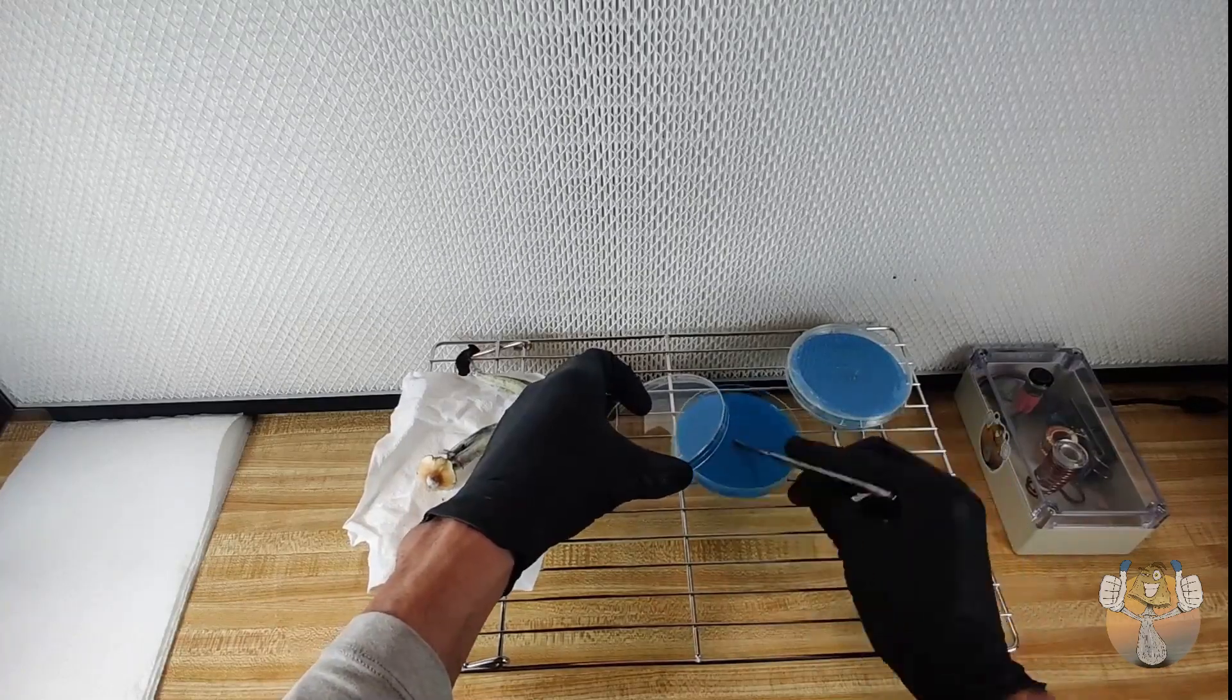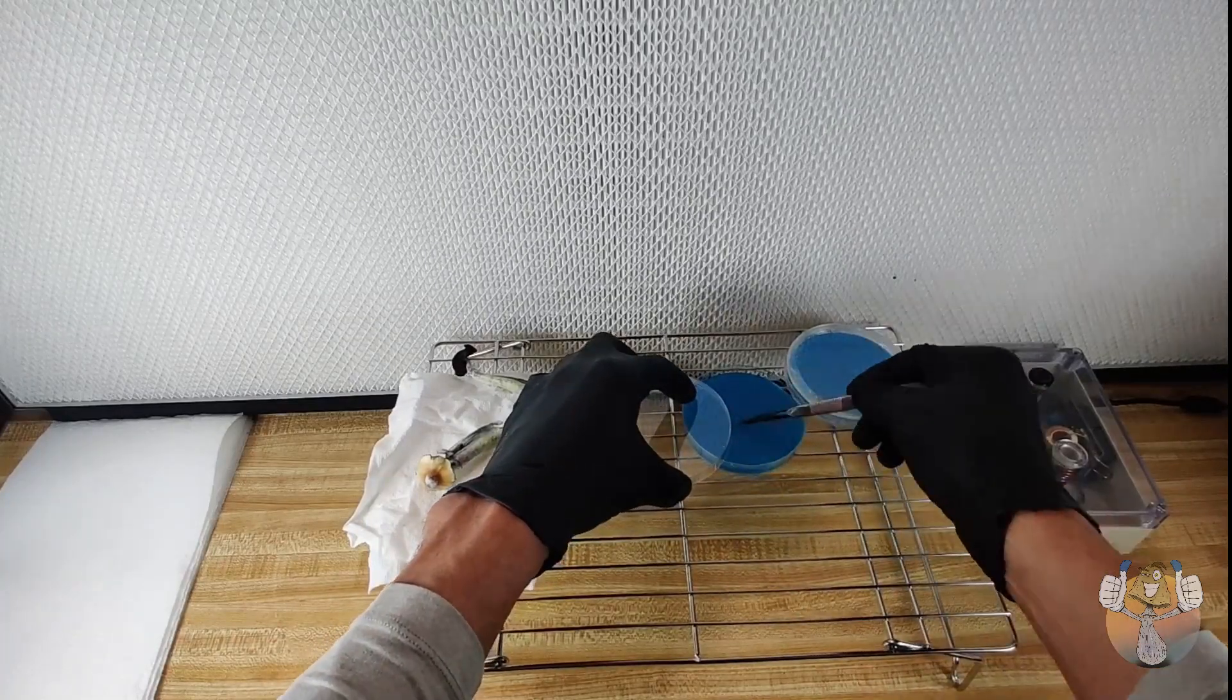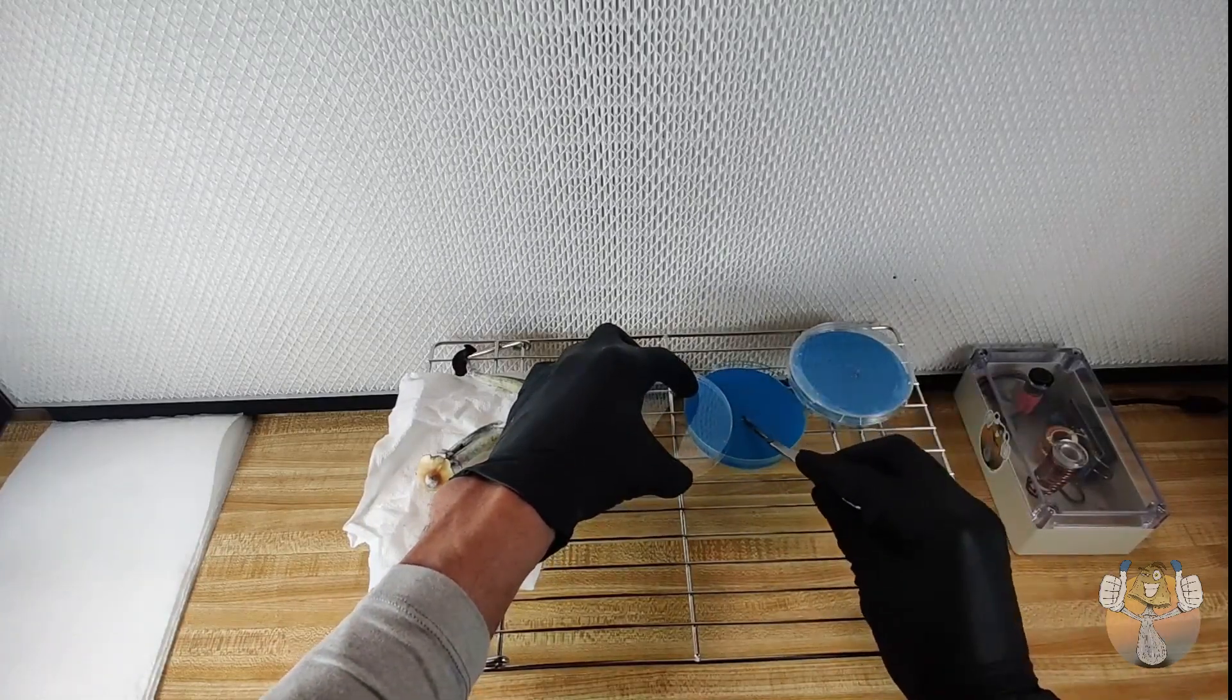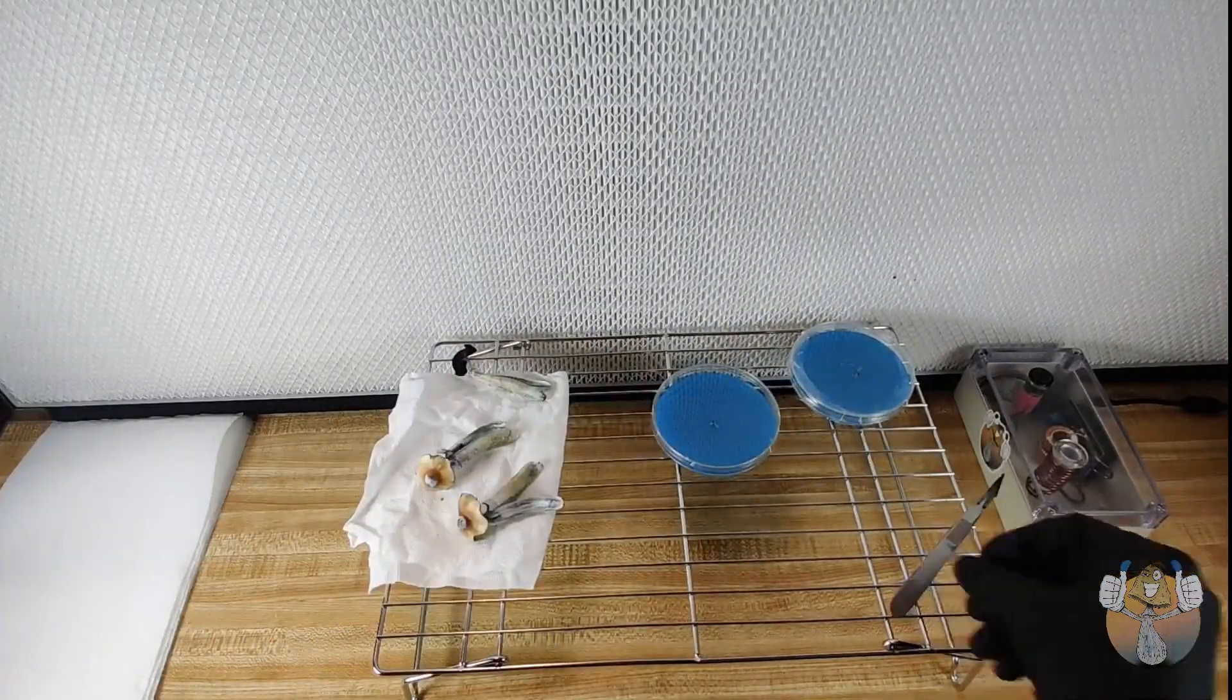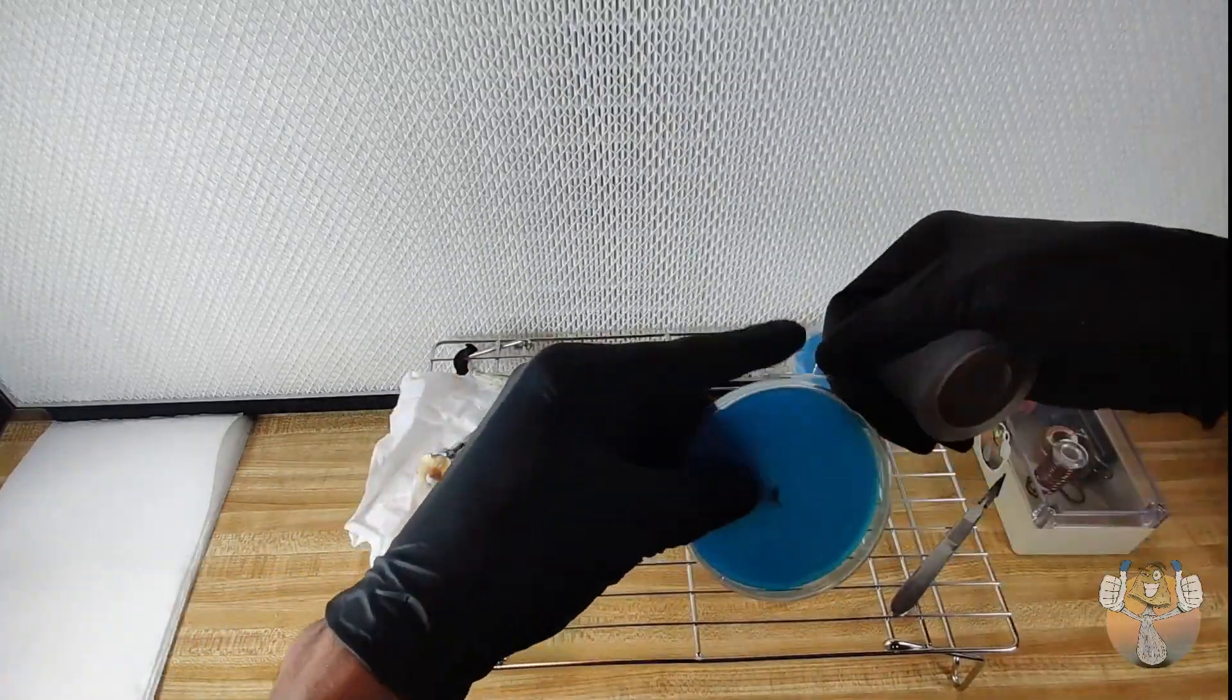So we're going to go ahead and place this on our agar dish as well. This one was giving me a tough time to get off, but we got it jammed in there. We're going to tape it up with our micropore polyfilm.